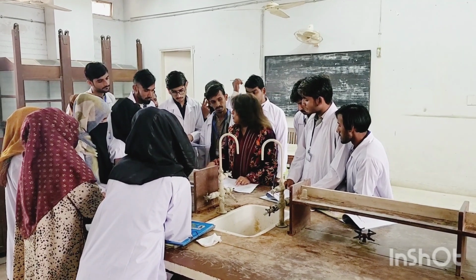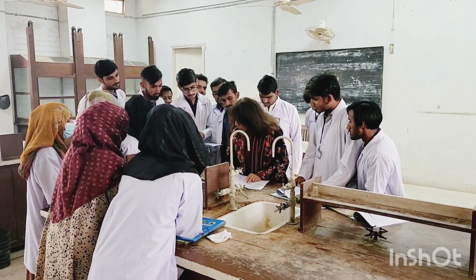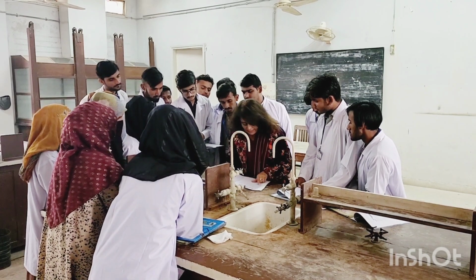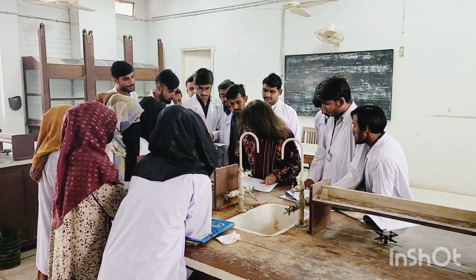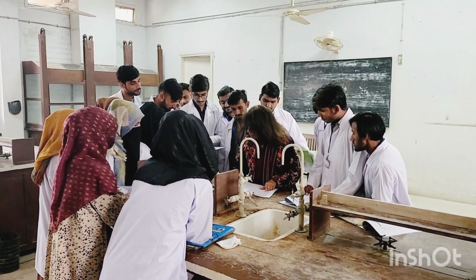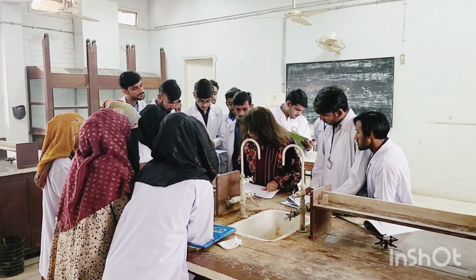I am now going to start the first step. So this is the first step. Now you are going to write down this thing: Preliminary, be careful about the spelling. Preliminary examination.